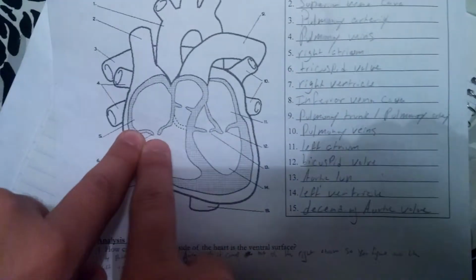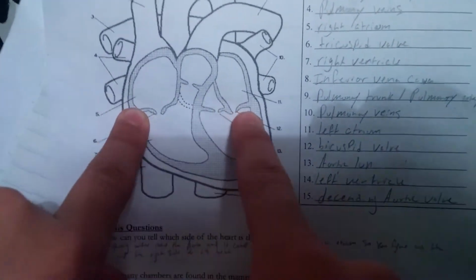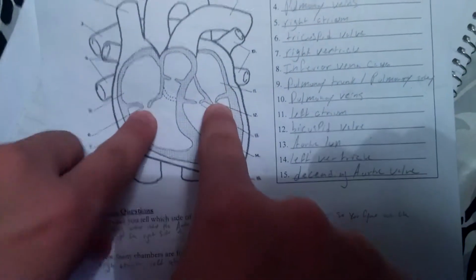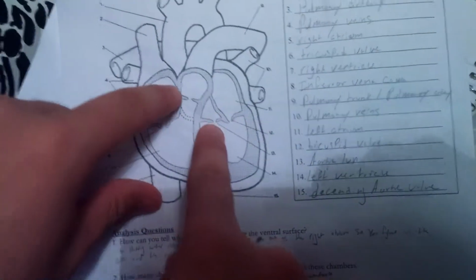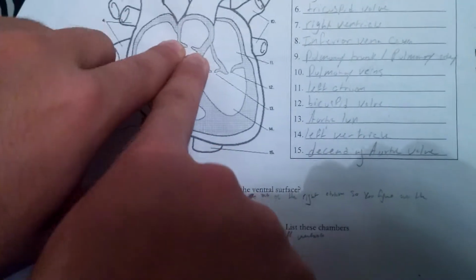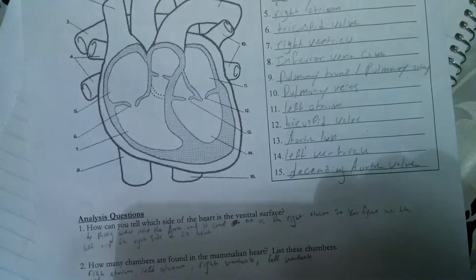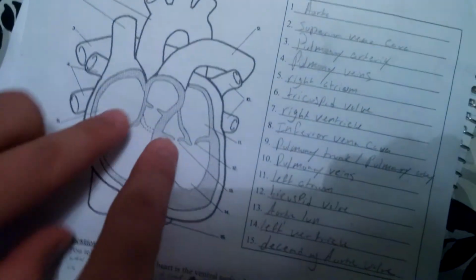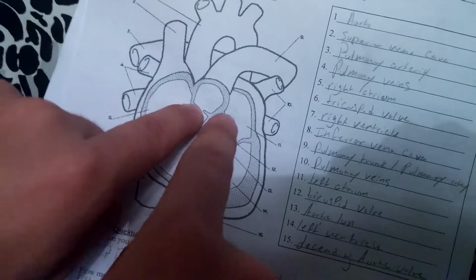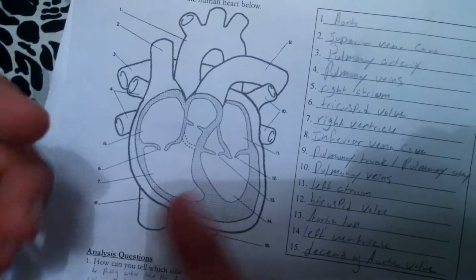I think when you compare them, you see that the tricuspid valve and the bicuspid valve are the ones that are bigger, and they actually look like they close, while the aortic semilunar valve and the pulmonary valve are a little bit more open. There's a little bit more space in between them to get the blood through a lot faster. So I think that would be the biggest difference: the size and the way that they close, and how the two other valves, the pulmonary valve and the aortic semilunar valve, don't close, or don't seem to be closed.